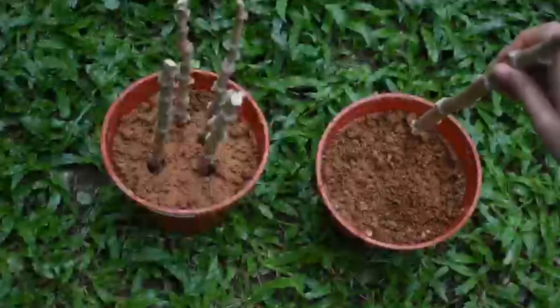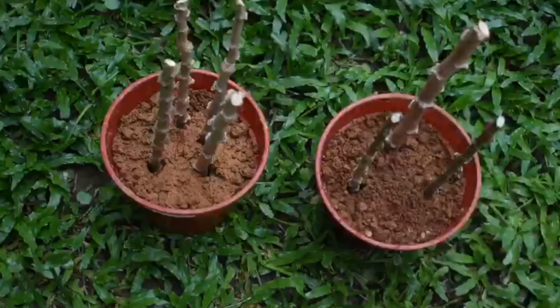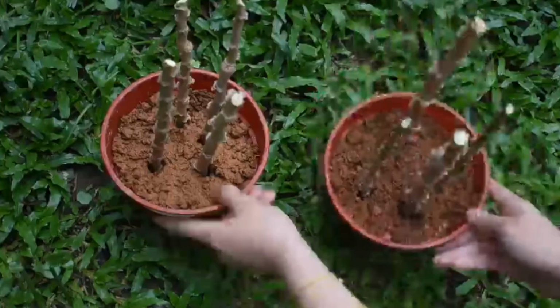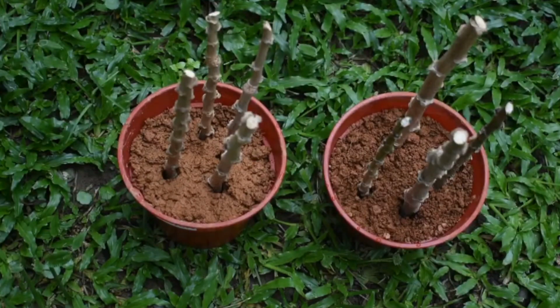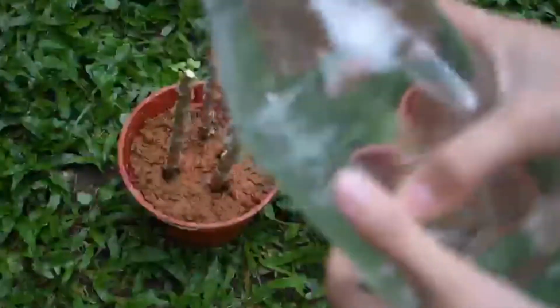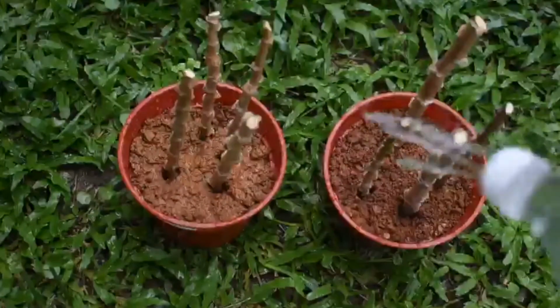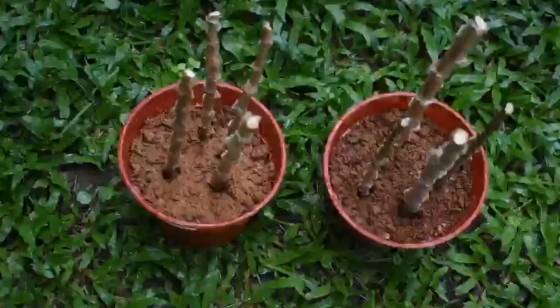As for the next vase, in which no auxin is needed, you can just dip the stem in right away. Make sure when dipping your stem into the soil, there are spaces in between your stems. Lastly, make sure to water your soil thoroughly so that your soil receives the proper amount of nutrients for root growth. We are going to come back in another 3 weeks for results.